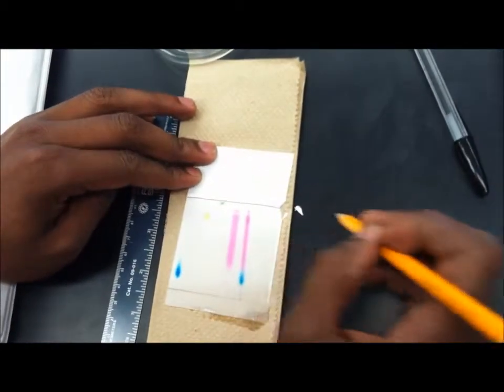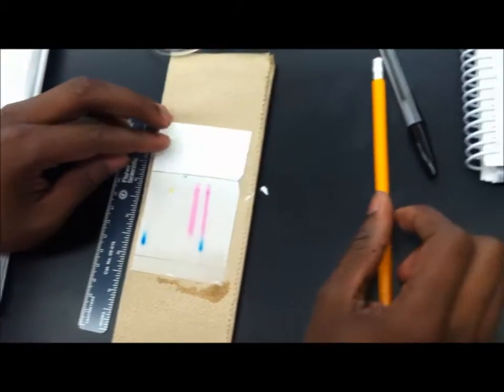And put it on the paper towel here. And we're going to mark with a pencil the way it's stopped. It should be like right here. And there we go.